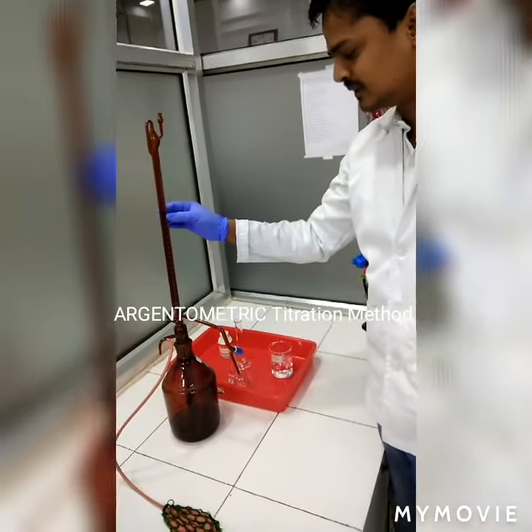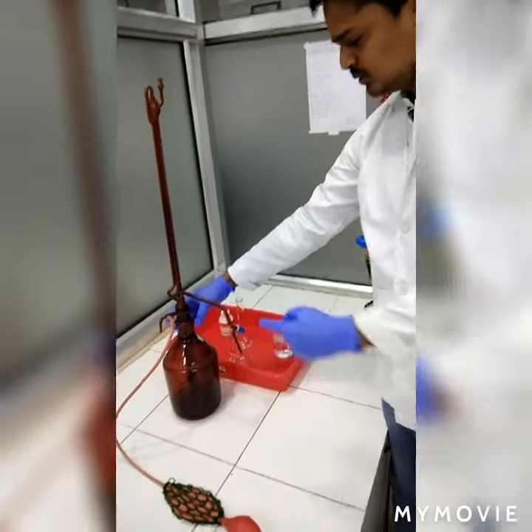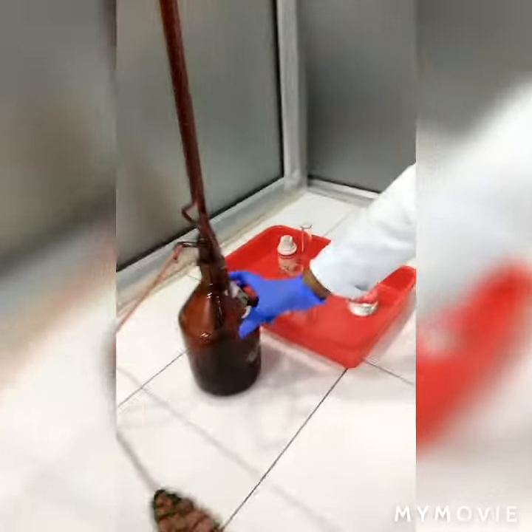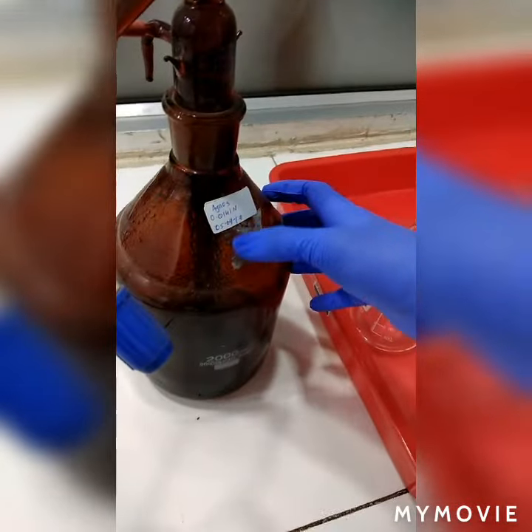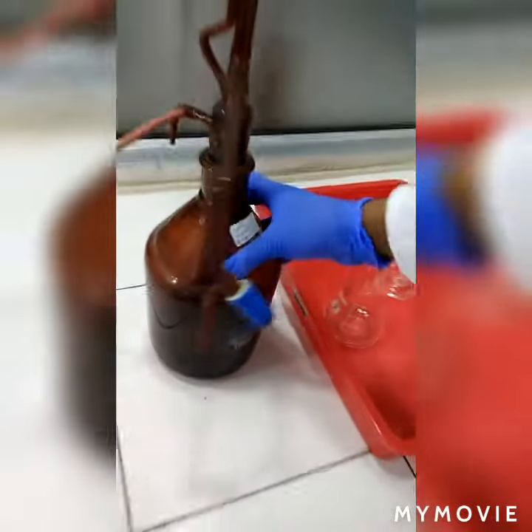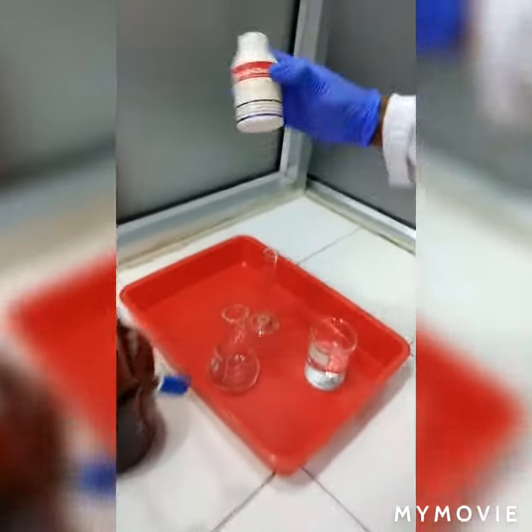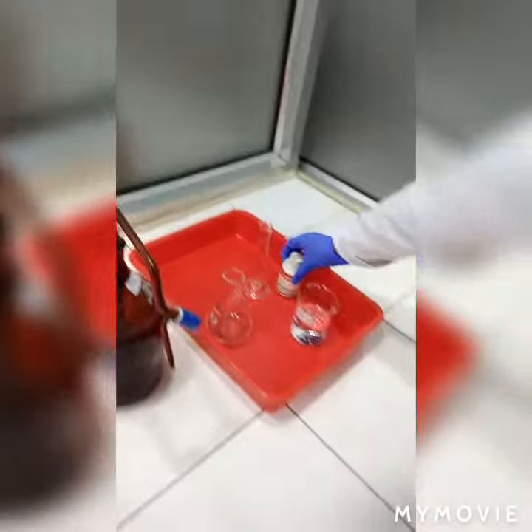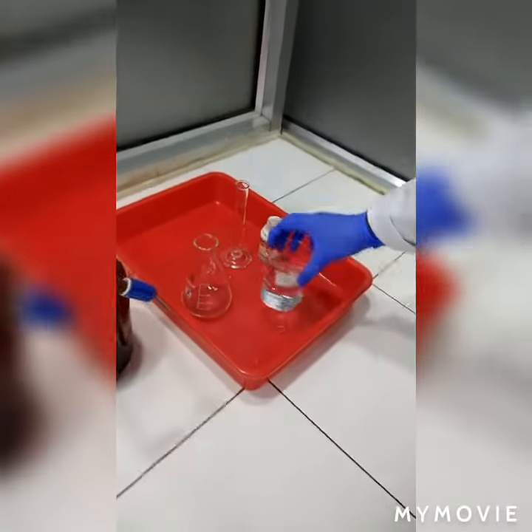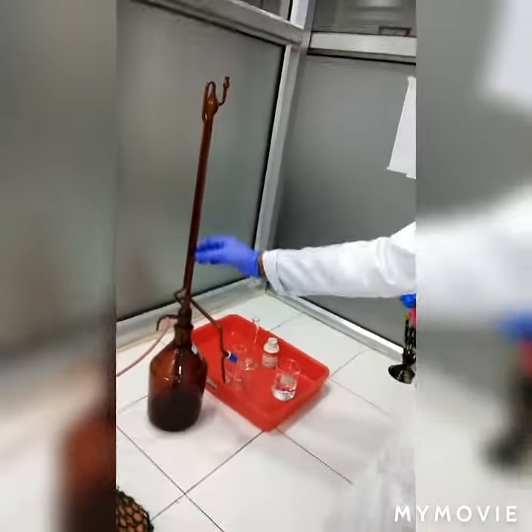This is an Argentometric Titration method. We are going to use AgNO3 Standard — AgNO3 of 0.0141 Normal. And Potassium chromate as an Indicator. And the Water Sample. This is an Auto-burette.